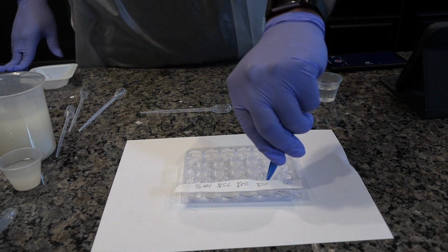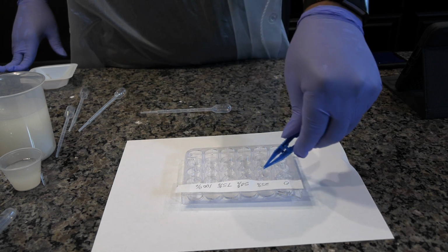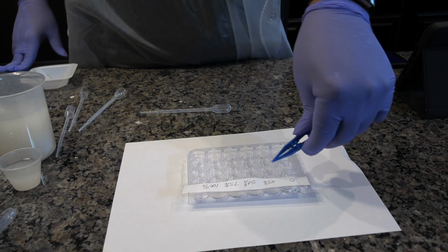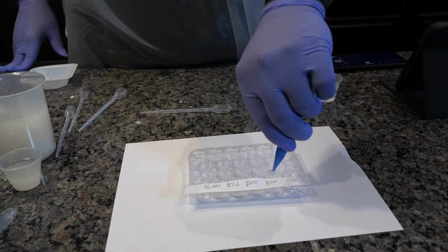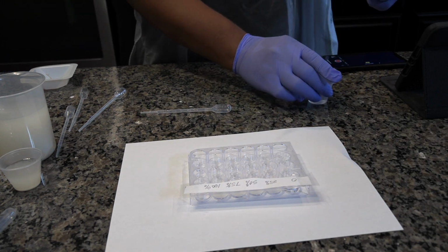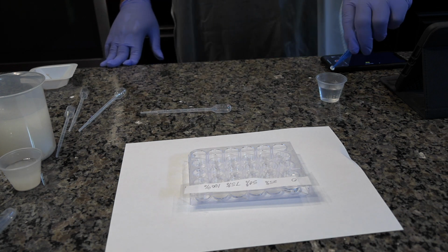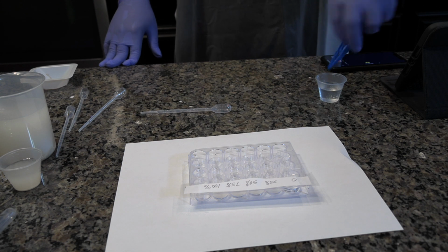Remove the used disc with the forceps. Perform 2 additional trials with a new soaked disc from the control, 0% catalase. Swirl the well plate again prior to dipping each filter paper disc. Conduct 3 trials for each of the remaining catalase solutions, 25%, 50%, 75%, and 100%.